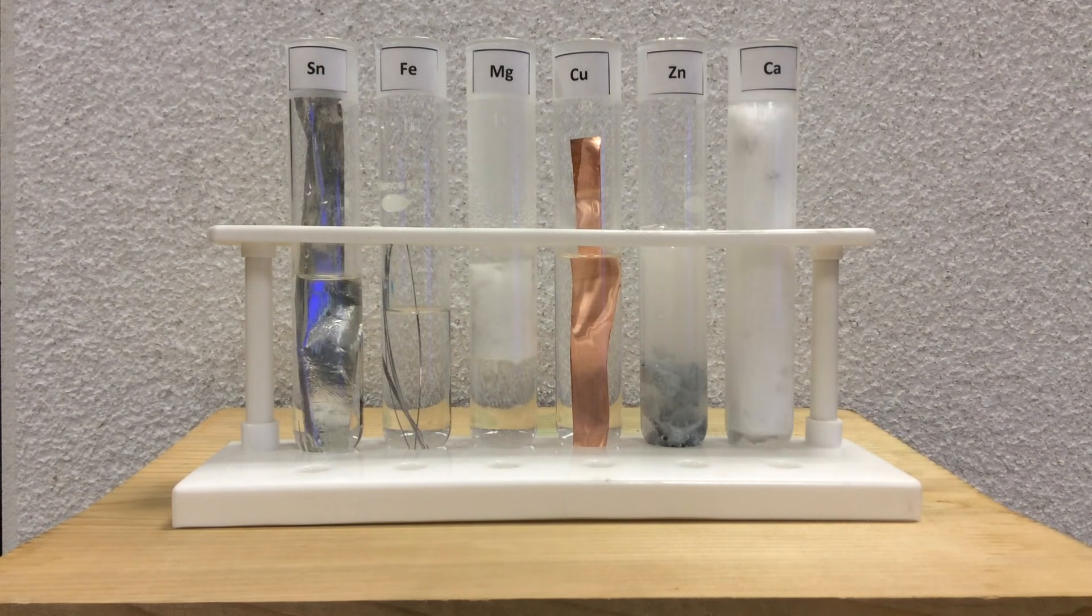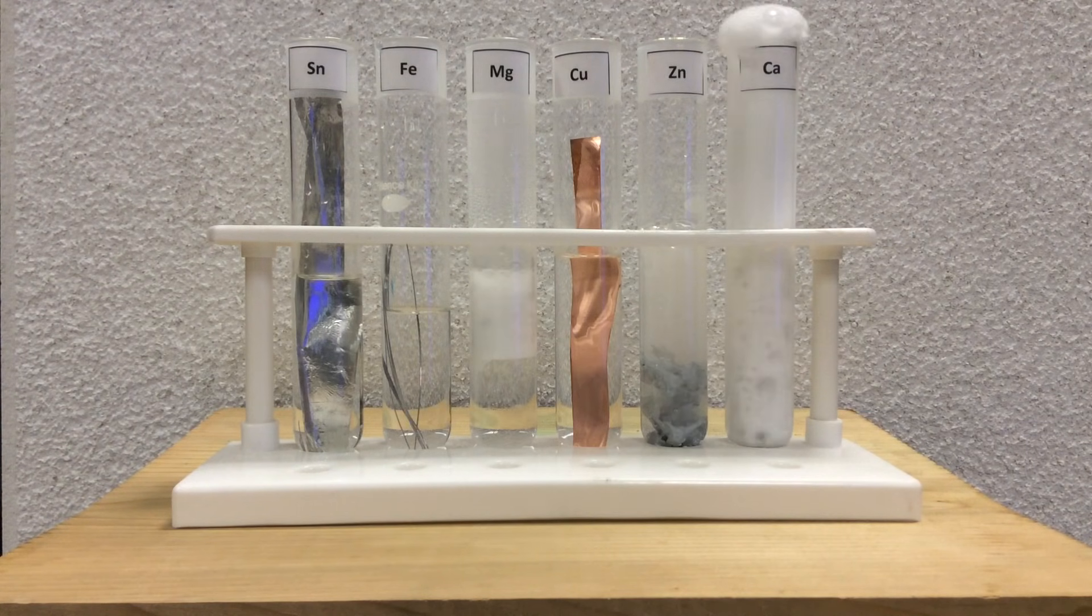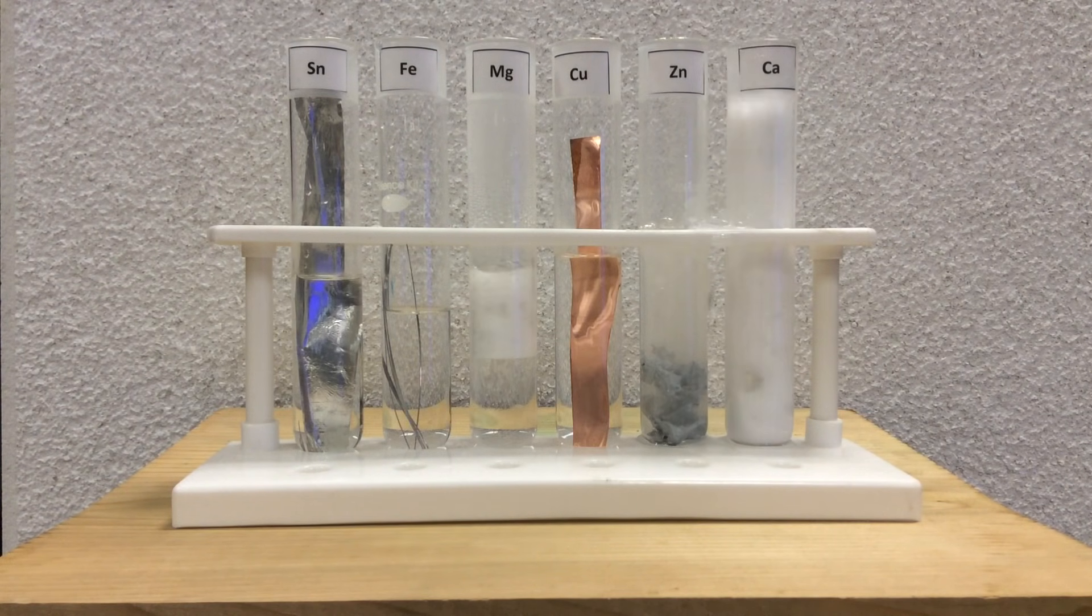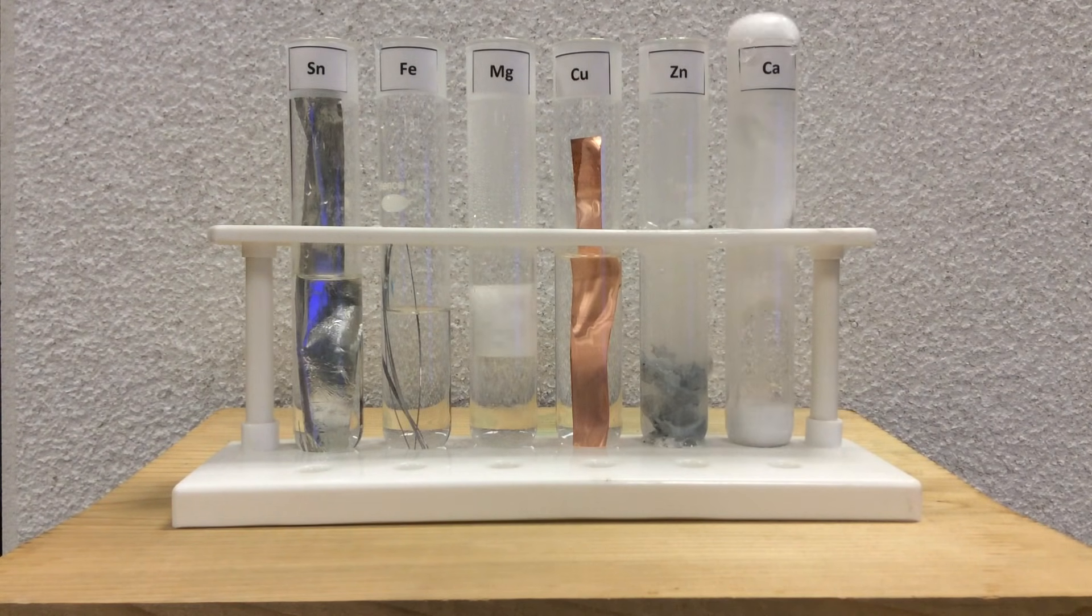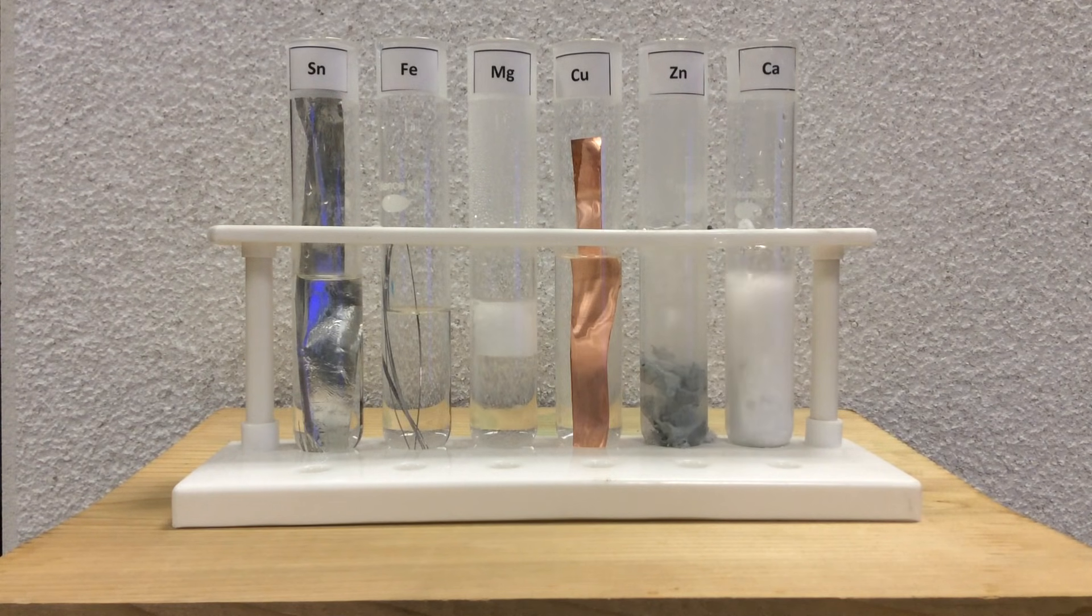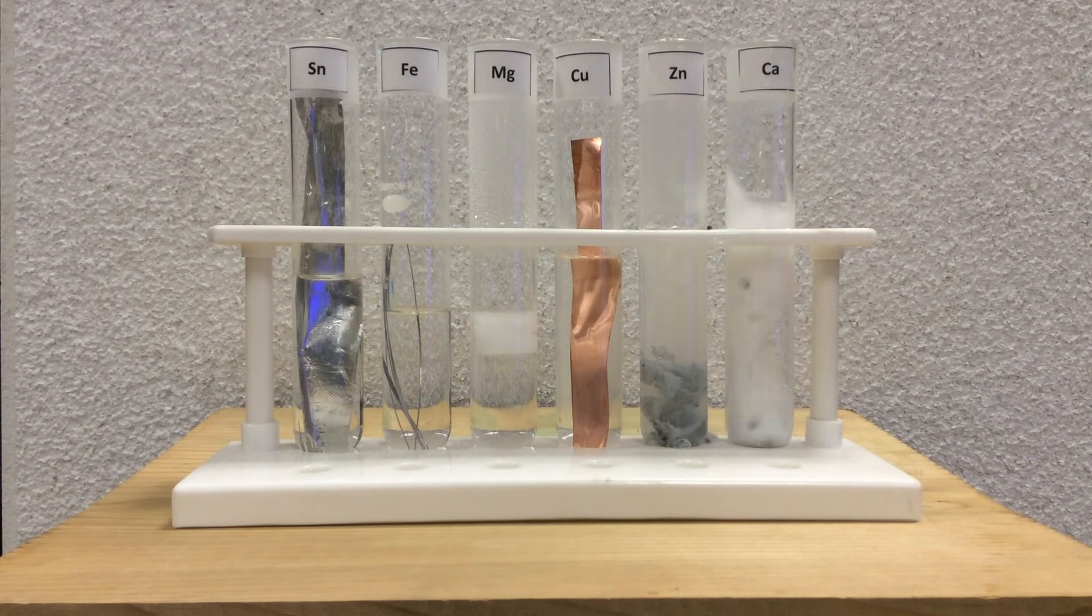Okay, so you can see that probably calcium is the most spontaneous. It's the best at losing electrons or passing its electrons to the protons. Okay, although we can't fall in love with the rate of reaction here. Rates of reaction aren't always going to mesh with spontaneity.